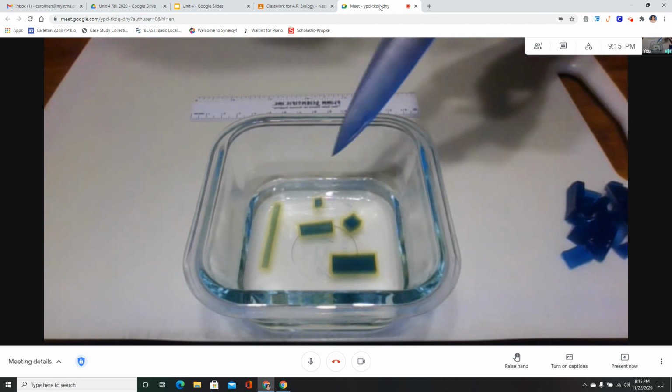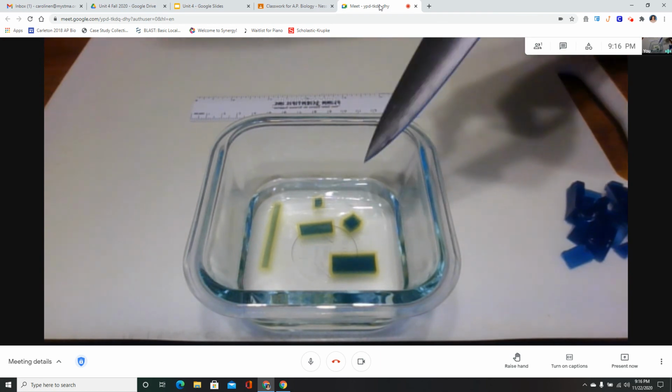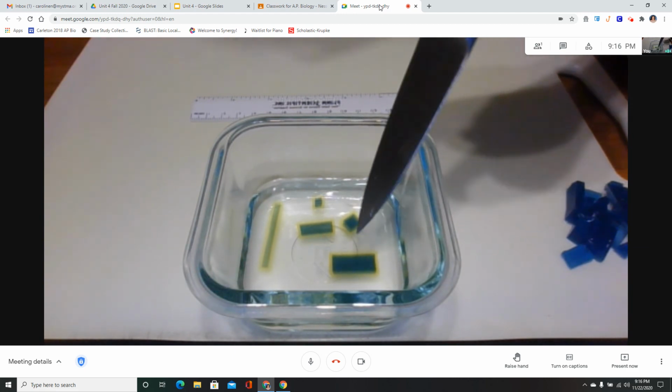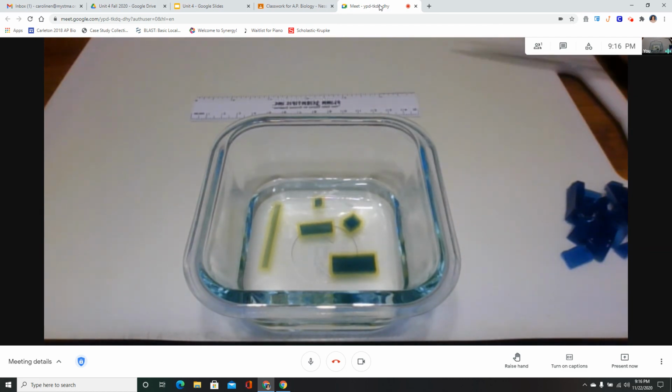So we have here a very tiny cube. That's my small cube right there. This is the larger cube that I made. So those two are the same shape, but different sizes. We have kind of a smaller sized rectangle here and a larger rectangle. I don't know if those are exactly proportionate, but they're similar. And then one very long, skinny rectangle, just so we can look at a few different shapes.